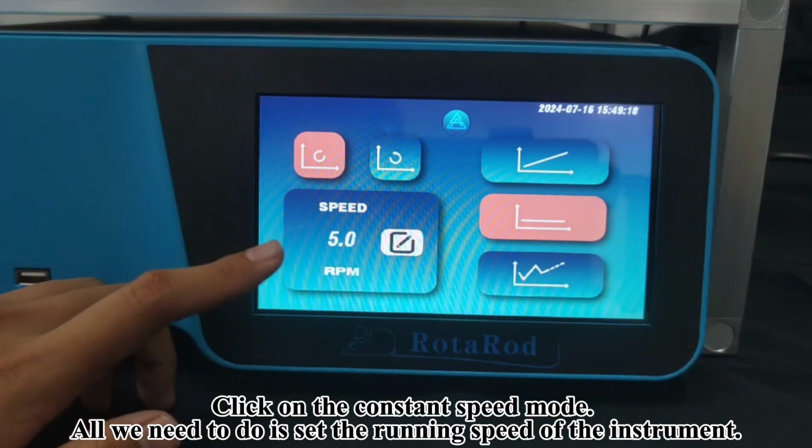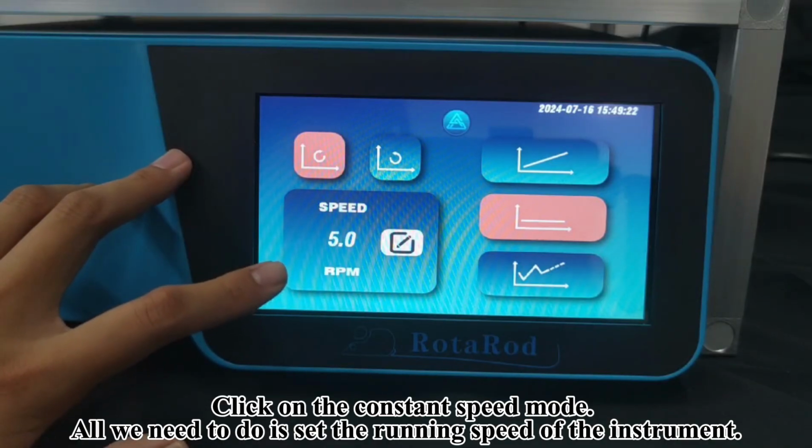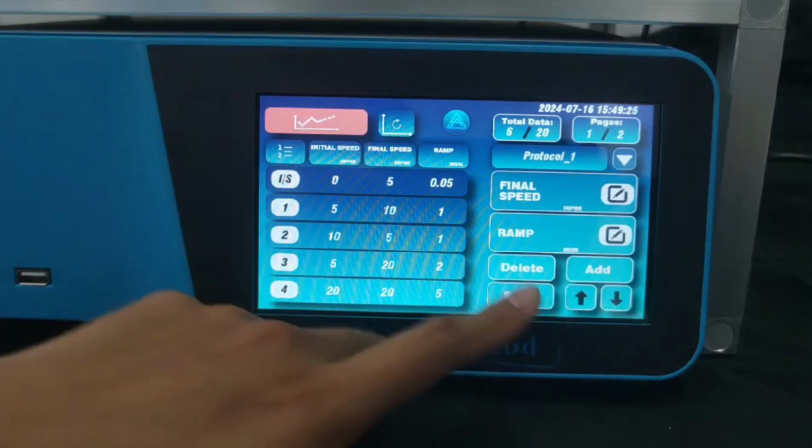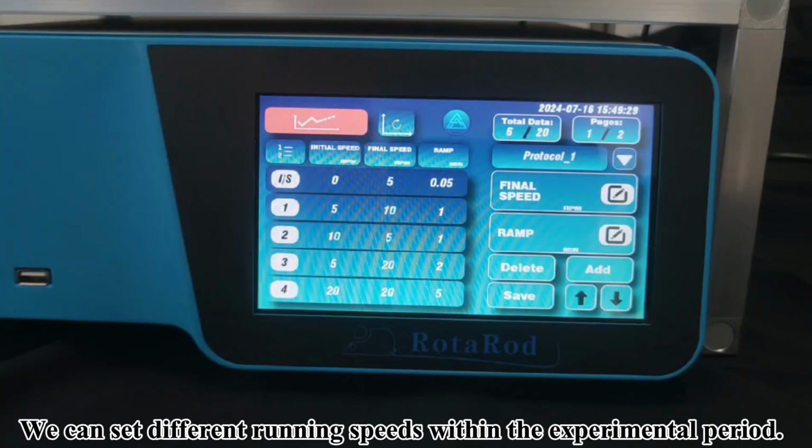Click on the Constant Speed mode. All we need to do is set the running speed of the instrument. The third one is the setting of section speed. We can set different running speeds within the experimental period.